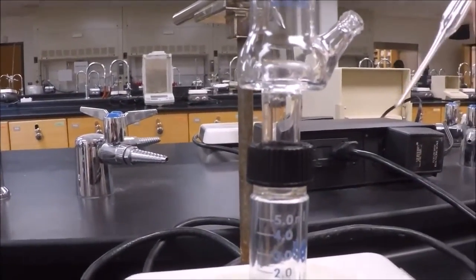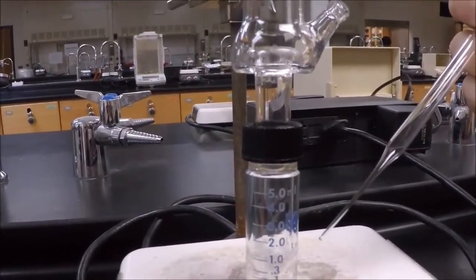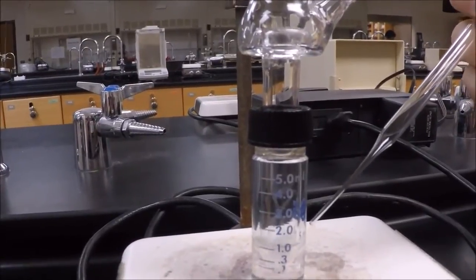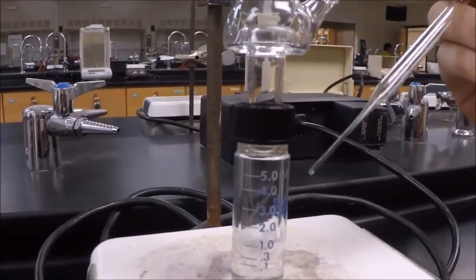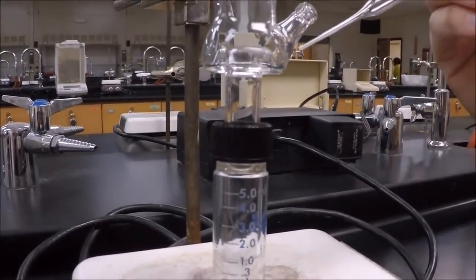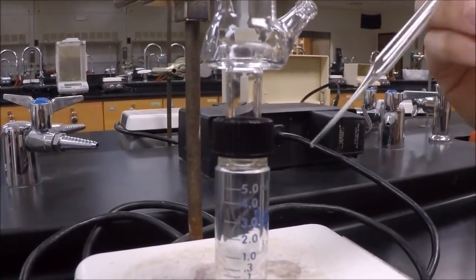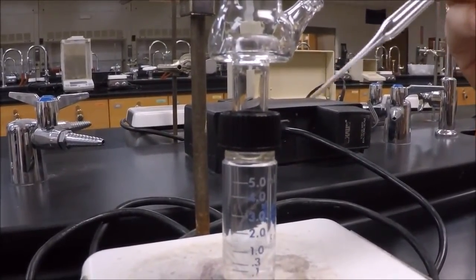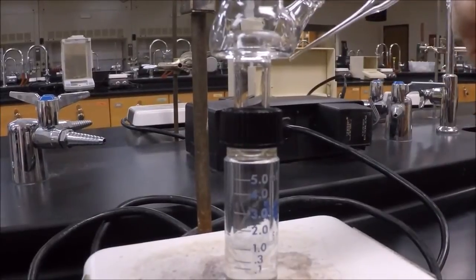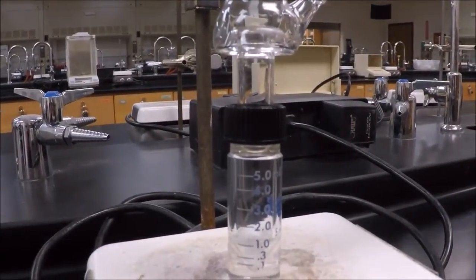As this is refluxing, be aware that if it's too hot, bubbles can start appearing up in the conical vial and up in the neck. We want to make sure that doesn't happen because if bubbling over occurs, we can contaminate the pure hexane with toluene and mess up our product. So as this is heating up, make sure no bubbles appear up here. If there are, just turn down the heat and hopefully they go away.